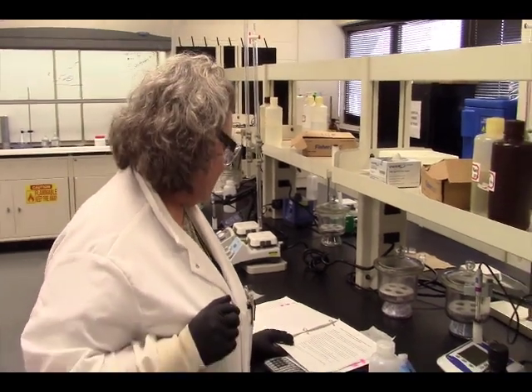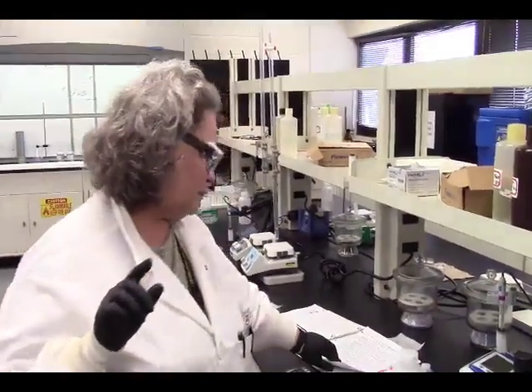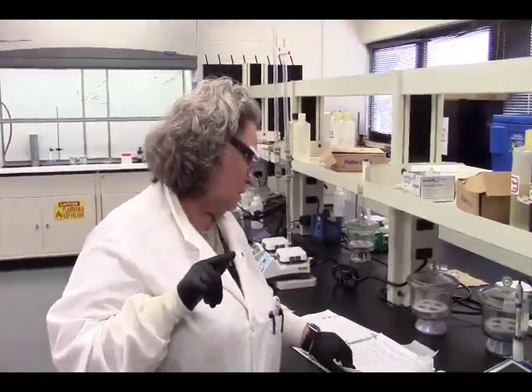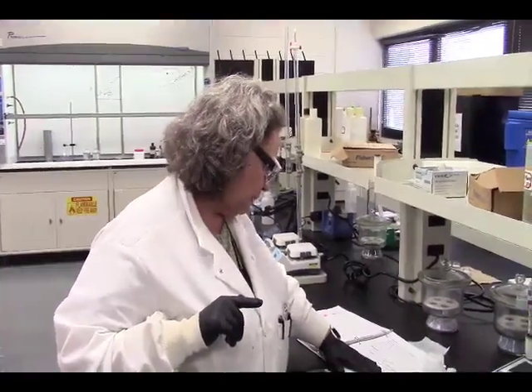All right, so this lab is going to pertain to the synthesis of cobalt complexes to look at visualizations of how ligands will affect the metal in UV-Vis. So we're going to use UV-Vis to explore property relationships between these cobalt complexes. To do that, we have to synthesize all these cobalt complexes, so we're going to be following our procedure here.